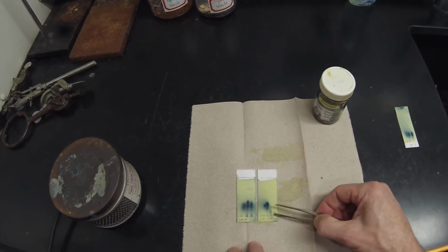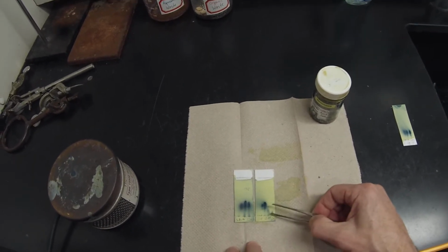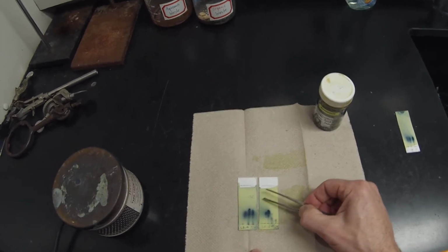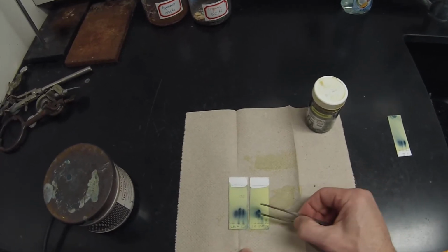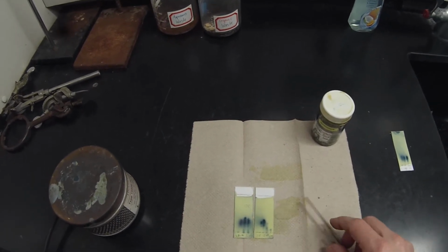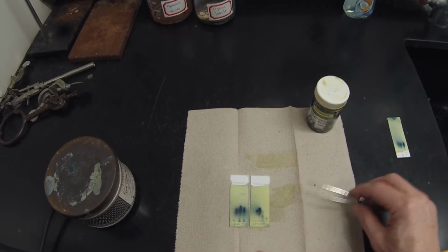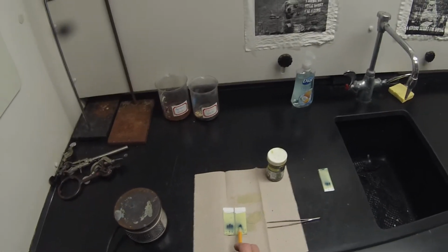What we're after is getting rid of these trailing spots, you'll see them there, which are probably aldol condensation impurity, and this top spot, which is probably biphenyl impurity. So we're isolating just this alcohol. So 9, 10, 11, 12 on one plate, 14, 15, 16, 17 on another plate, and we'll try to find out where that material starts and stops.